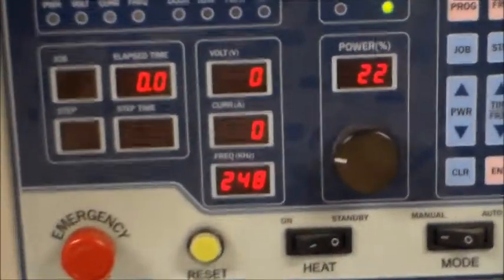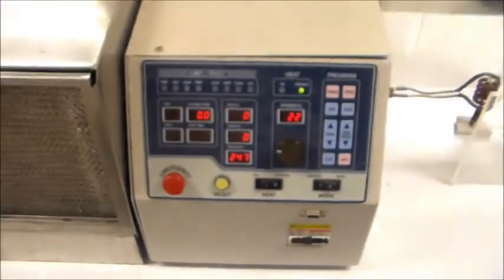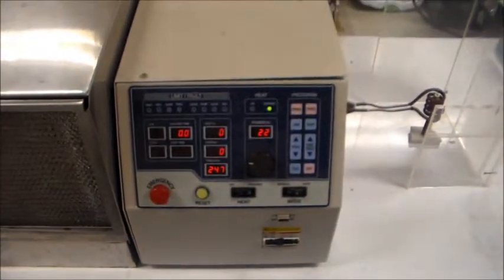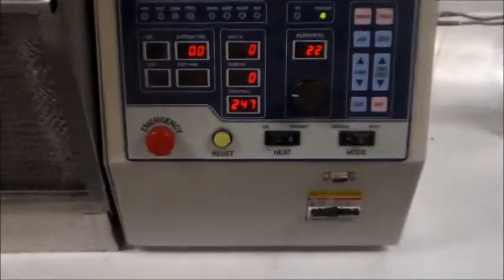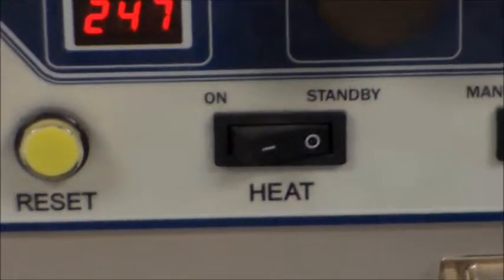At this point, the power has been set, but the heater is not actually heating the material yet since the heat switch is in the standby position, which means that the system is running in the standby mode.